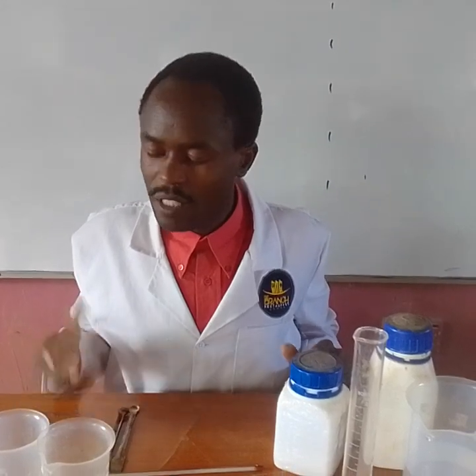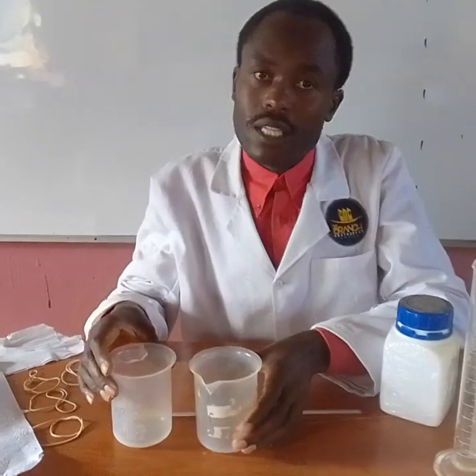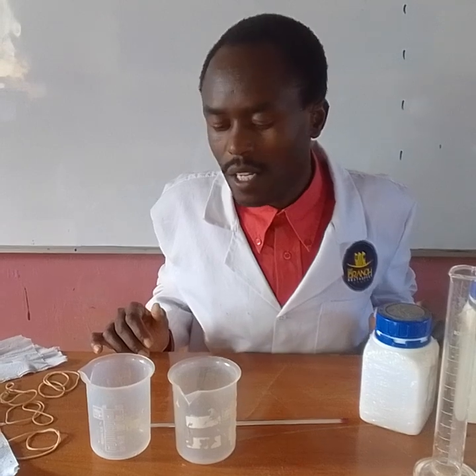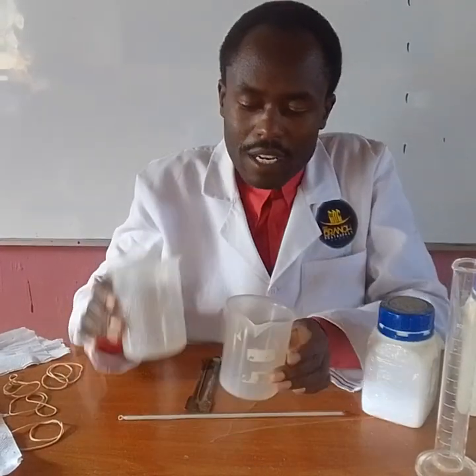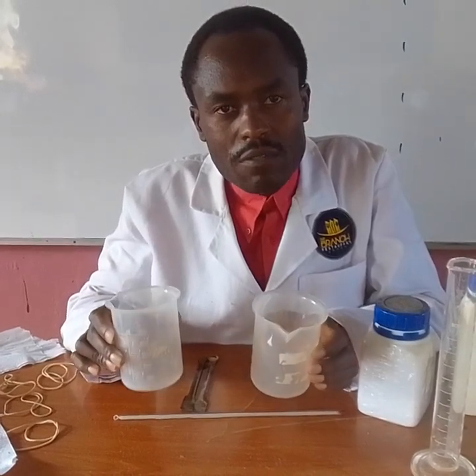reactions. So my student, without wasting time, I have apparatus here and some chemical reagents we are going to use in this lesson. Let me take you through very fast. First of all, I have two plastic beakers which are 250 ml.